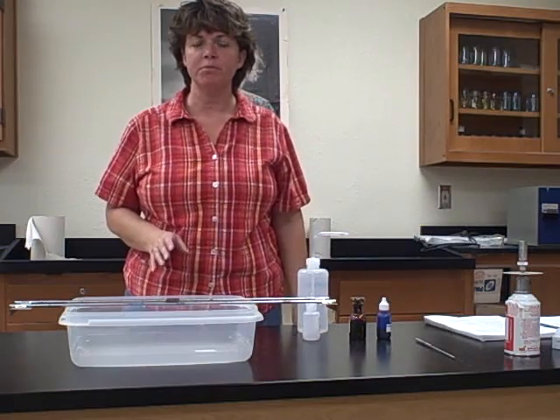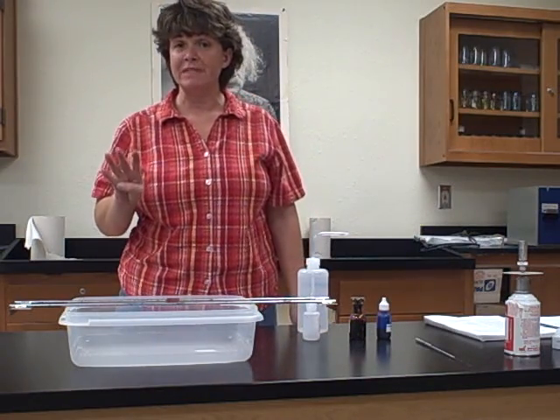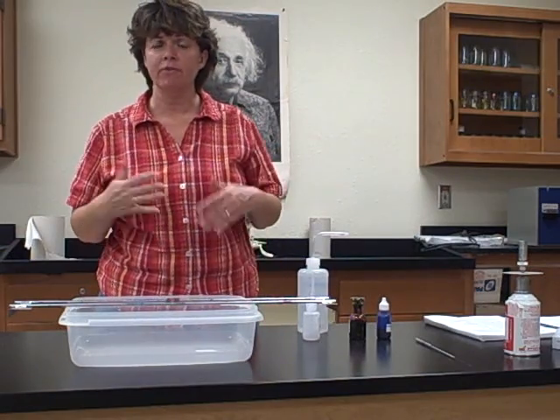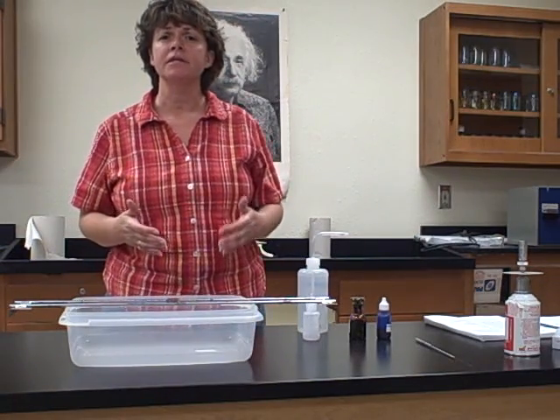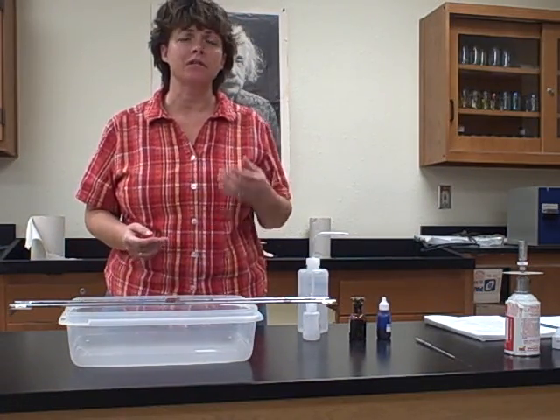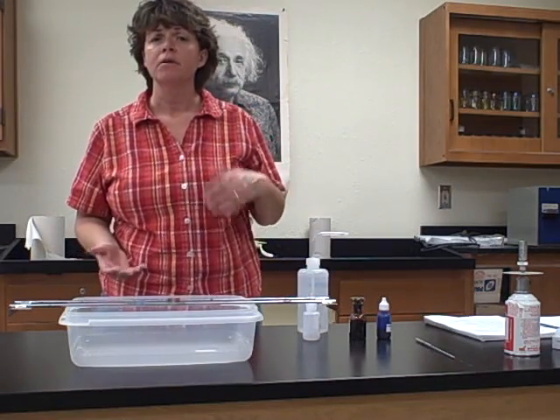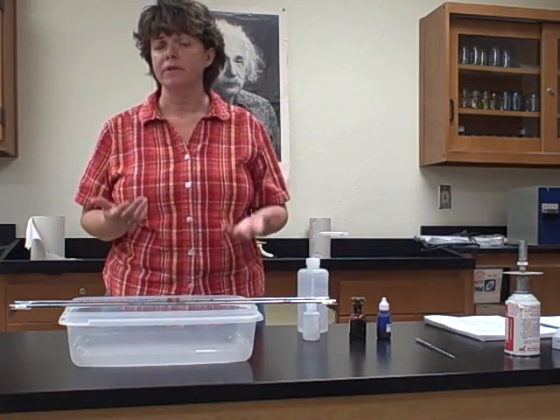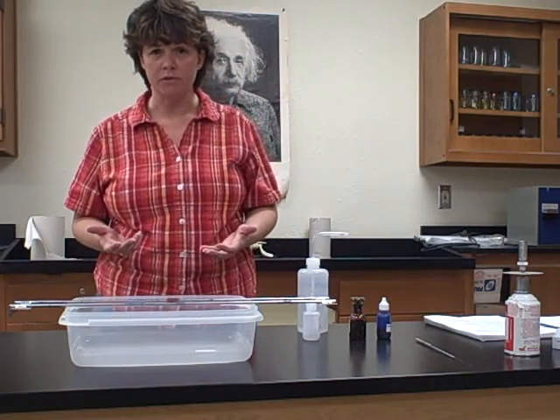This week we're going to be performing 4 different stains. So we're going to have to be very efficient and make sure that we have all our supplies organized. We're going to see a lot of different stains that look the same and sound the same, but we want to make sure that we're using the correct stain at the correct time, because of course if you don't, you're going to end up with the wrong result.